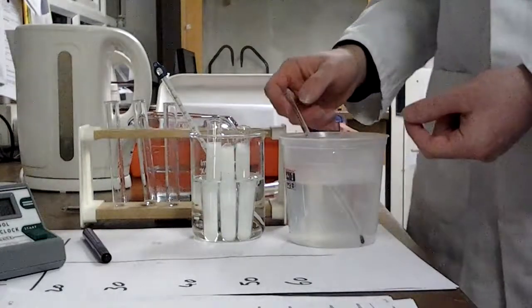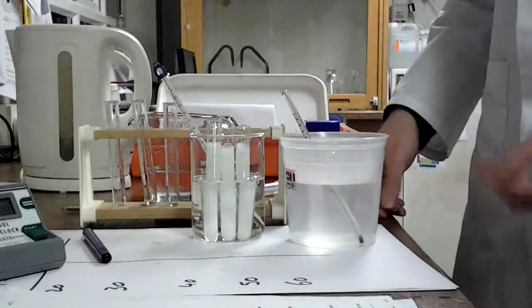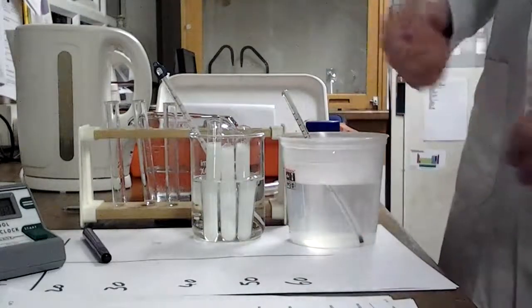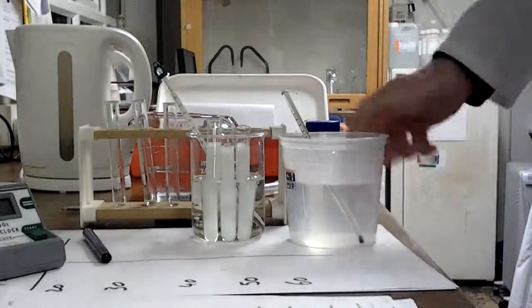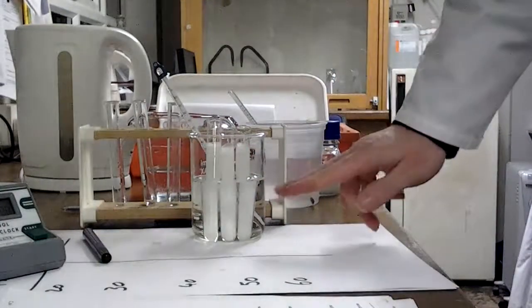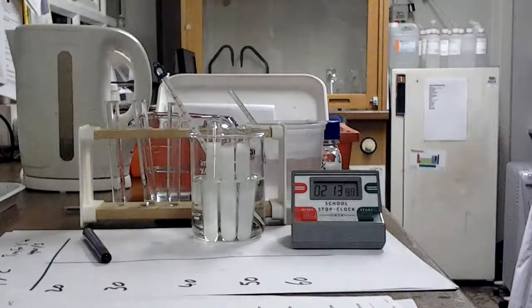This will be most of an issue when you get up to your highest temperature. Obviously 60 degrees it's going to cool down far faster than 30. So you will need to keep an eye on your water bath and do a bit of topping up with the warm water to keep it at the right level. Okay, so whilst that's just getting to its next level, we'll leave this going. It's going to take a few minutes, so there's our stop clock. I'm going to pause the video for a little while.